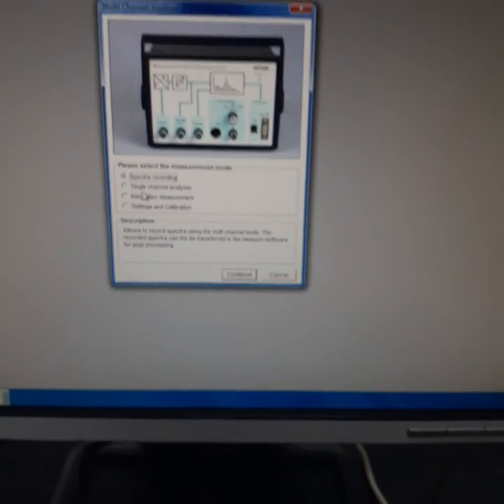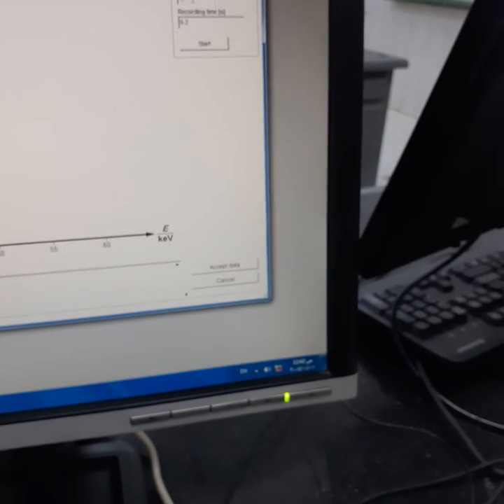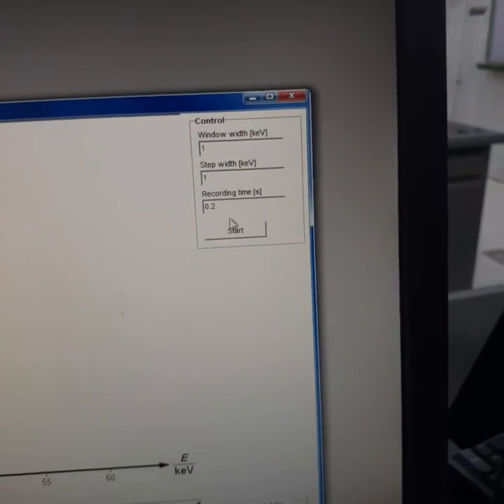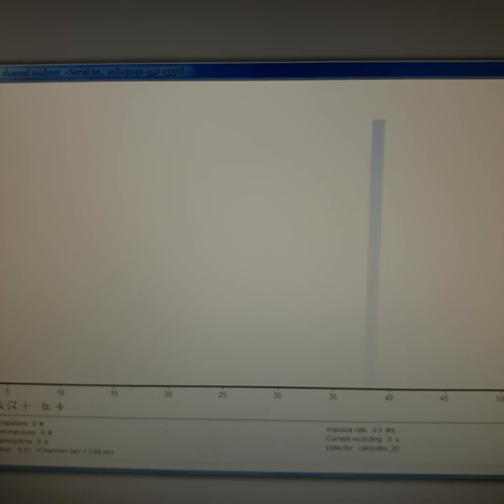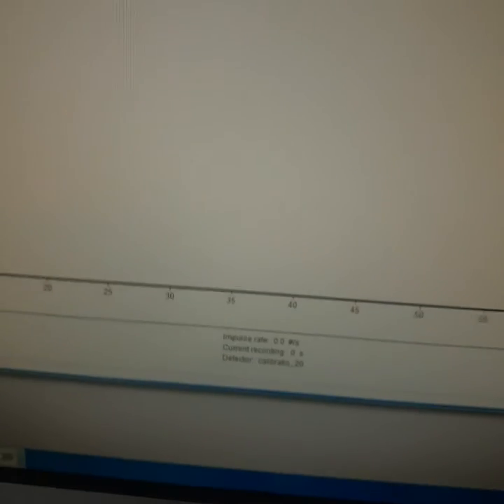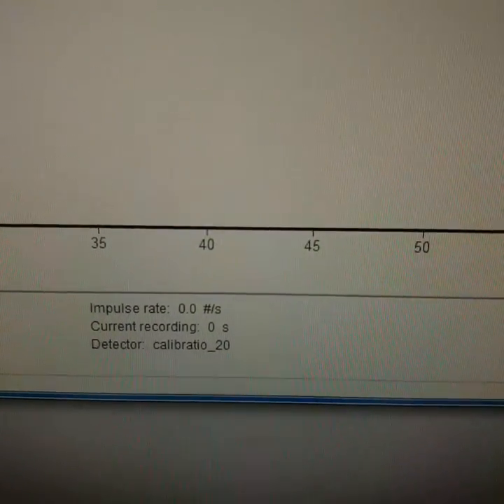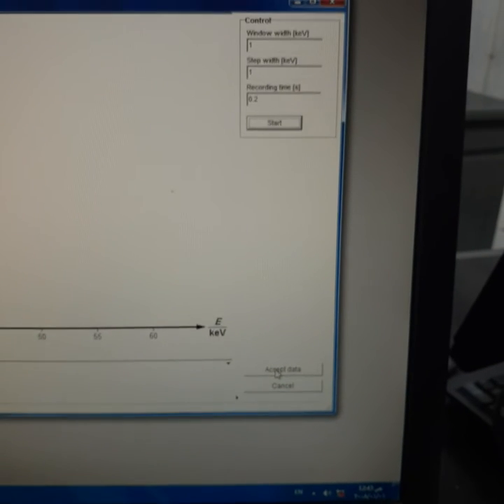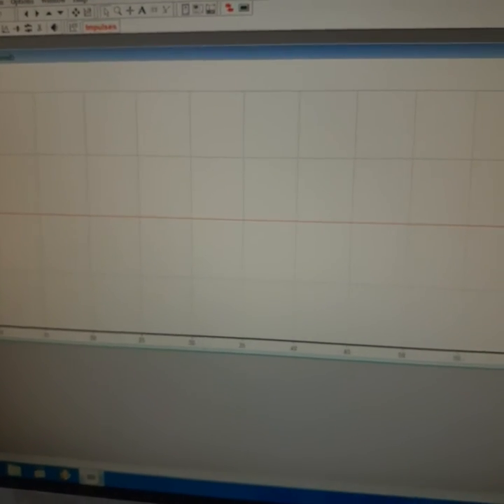once again, then we can use a single channel analyzer. Continue. Then we set the step width, for example, 1 kilo-electron-volt, and the recording time for each single recording is 0.2 seconds. So we will start recording. You can see here, the counting is already active, but there is no data appearing. So if we wait approximately 1 minute, for example, with the calibration number 20 we have used before, I think this is enough time for the data. But as you can see, if we accept the data that may be recorded in the software, there is nothing appearing once again here.